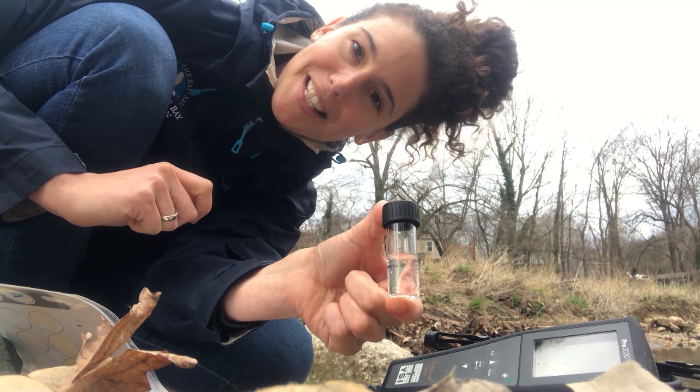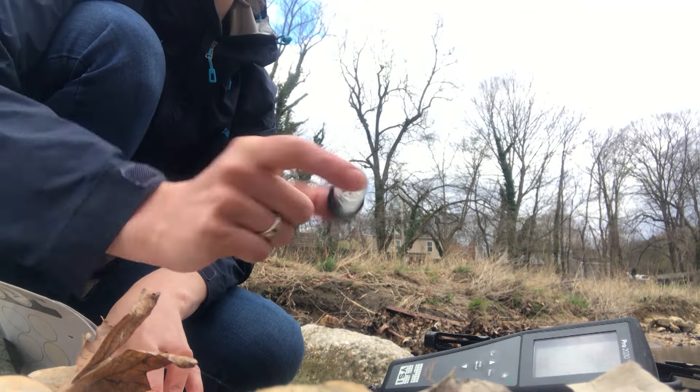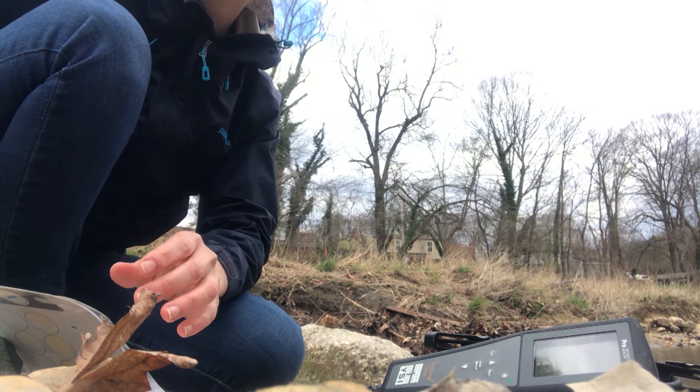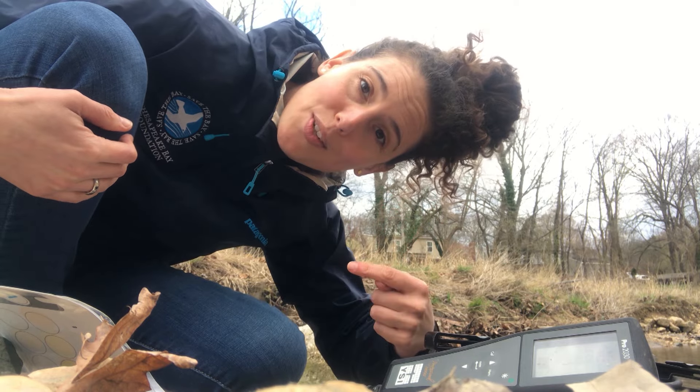Now I'm going to take a measurement of the nitrate level in the water. This level, along with the phosphate level, will give us an idea of whether there are excess nutrients in the water — and those excess nutrients can lead to algae blooms and dead zones further down in the Chesapeake Bay. I'll fill these two test tubes with stream water, add some chemicals, and shake for one minute. Now I have to let the color develop for five minutes, so I'm going to start another test.